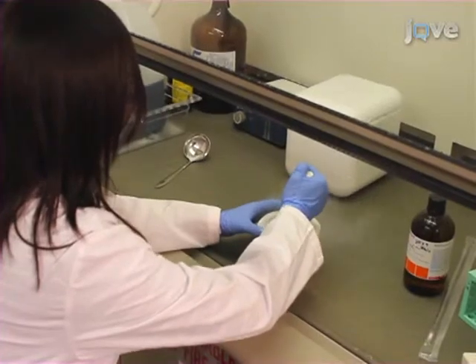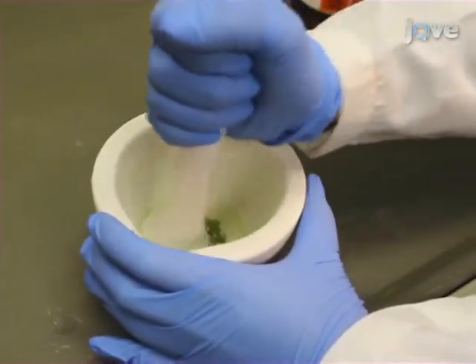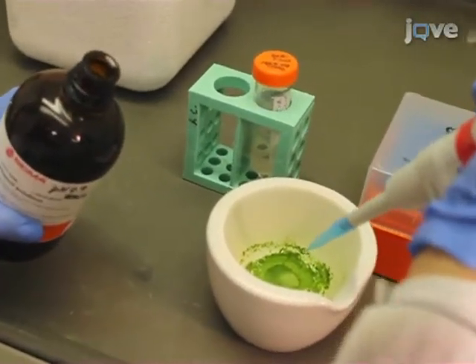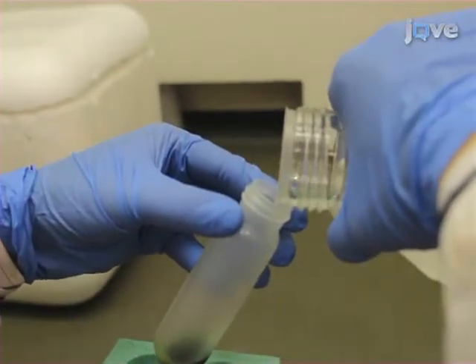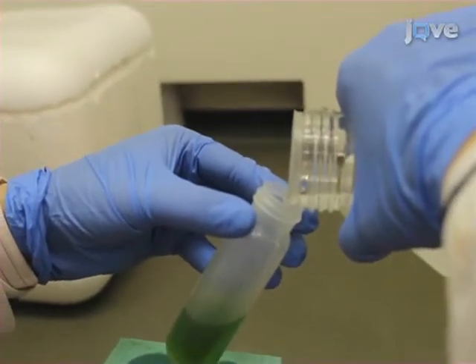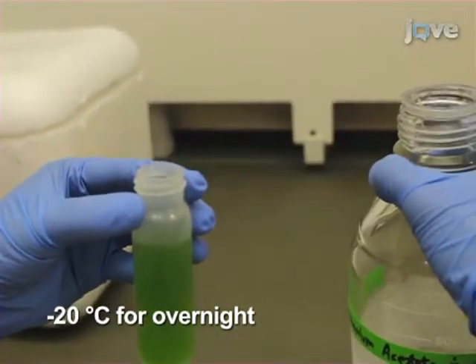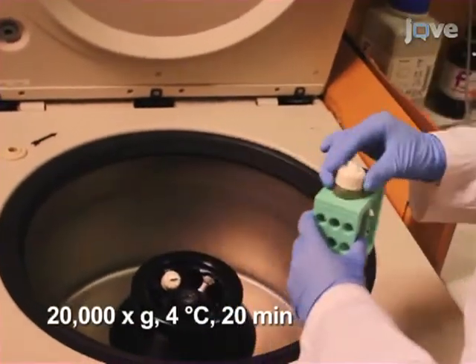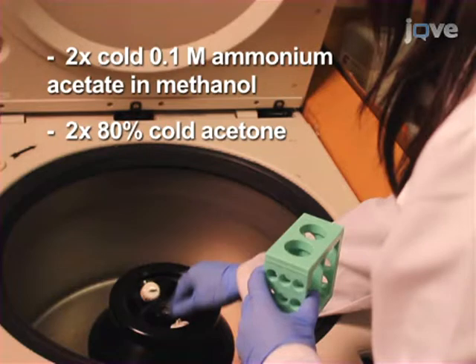Using a pestle and mortar, grind the harvested leaves to a fine powder in liquid nitrogen. Then, perform phenol extractions as described in the accompanying text. Next, precipitate phenol-extracted proteins with 5 volumes of cold 0.1 molar ammonium acetate in 100% methanol. Harvest the proteins by centrifugation. Perform pellet washes.